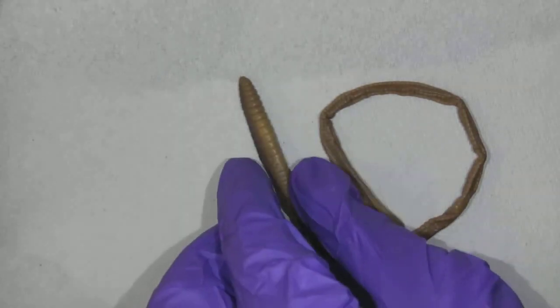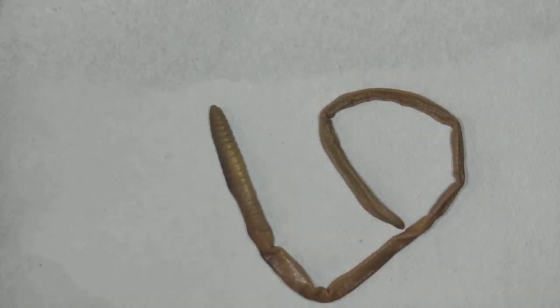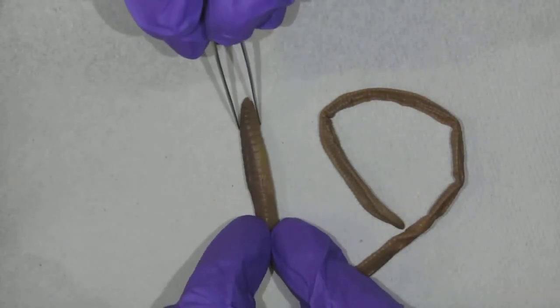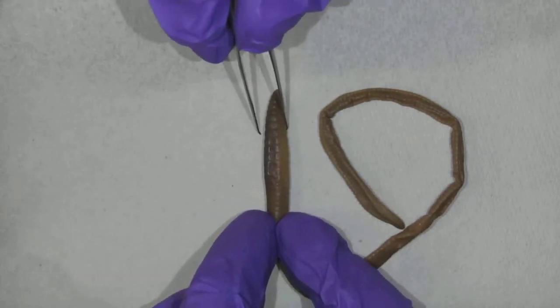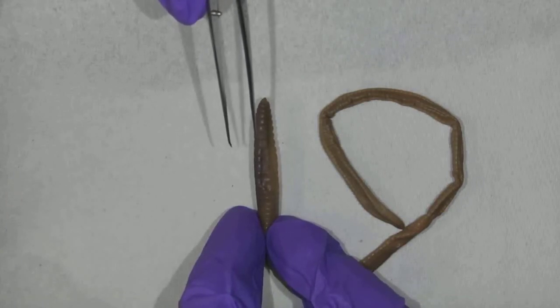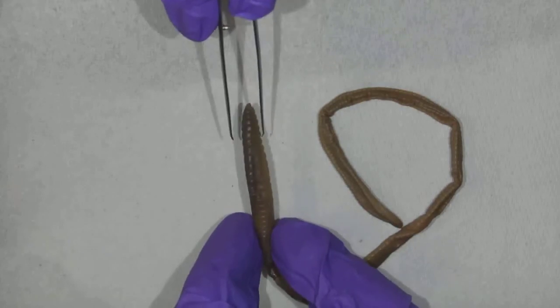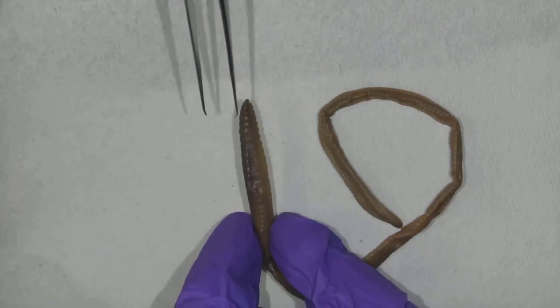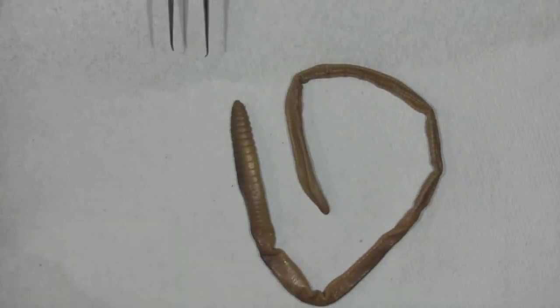Good morning. Today we are looking at the wonderful earthworm. This worm is preserved, so he's dead. But I really want to encourage you to go out and find a live worm somewhere in the world. Go dig up the ground, find a real worm that's alive, and watch it. They're such fascinating creatures. This guy, although dead, can teach us a lot.